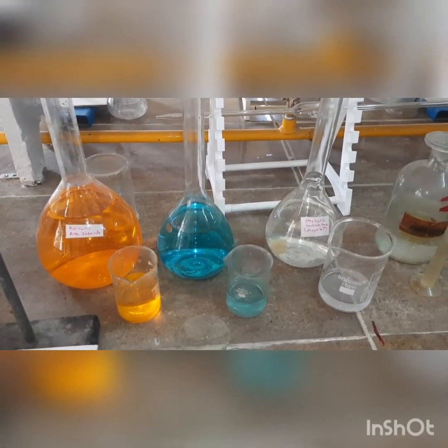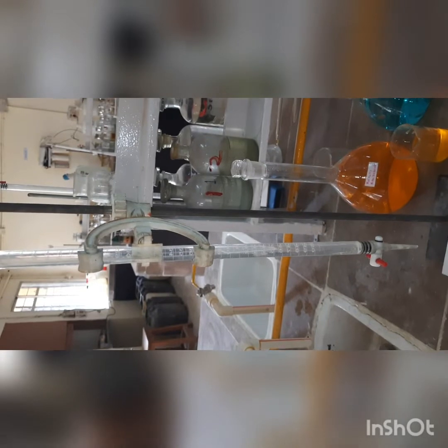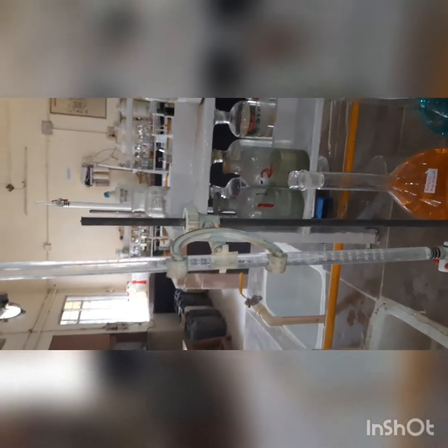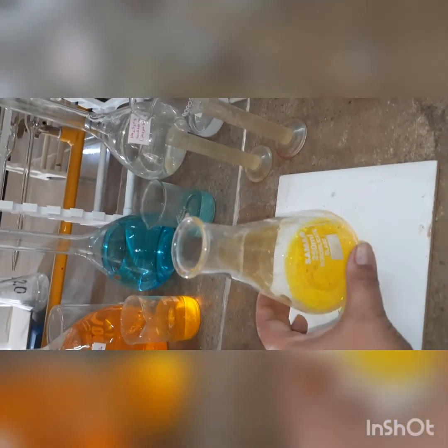Now let us first understand the procedure. The first part of the process is standardization of hypo solution. For this, I have filled the burette up to the mark with hypo. We have taken 25 ml of potassium dichromate. We will be needing 10 ml each of KI and dilute sulfuric acid, and we will utilize starch as indicator.